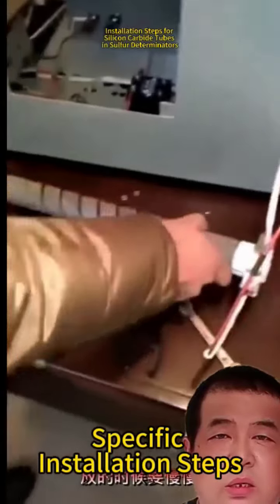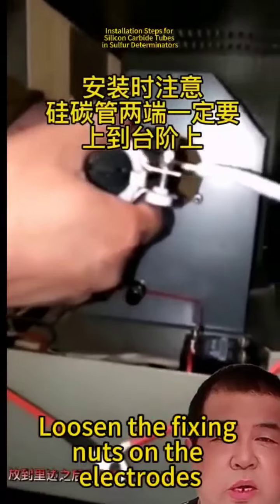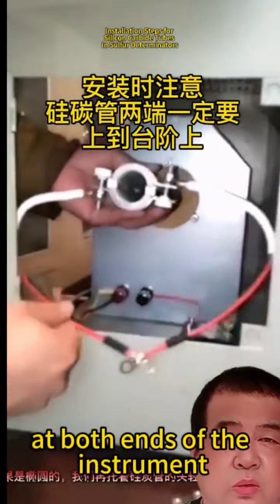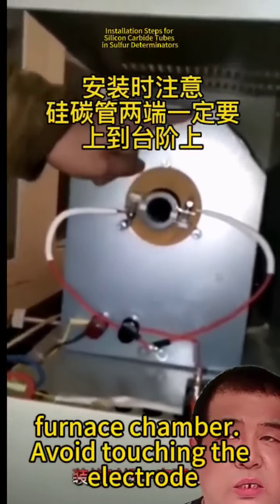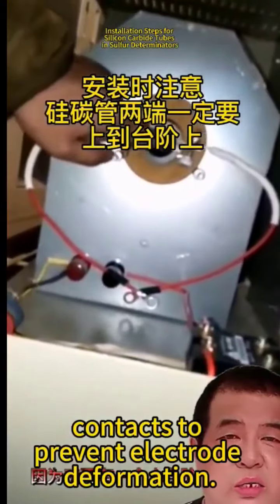Specific installation steps. Remove the old tube for replacement scenarios. Loosen the fixing nuts on the electrodes at both ends of the instrument. Gently pull the old silicon carbide tube out of the furnace chamber. Avoid touching the electrode contacts to prevent electrode deformation.